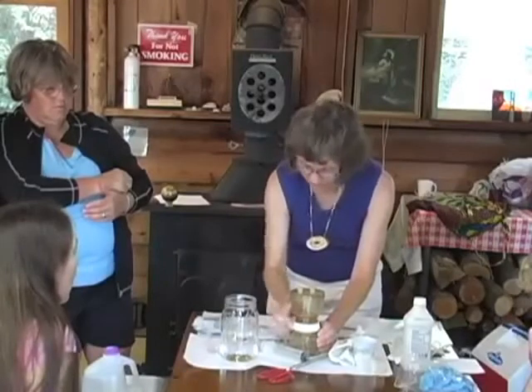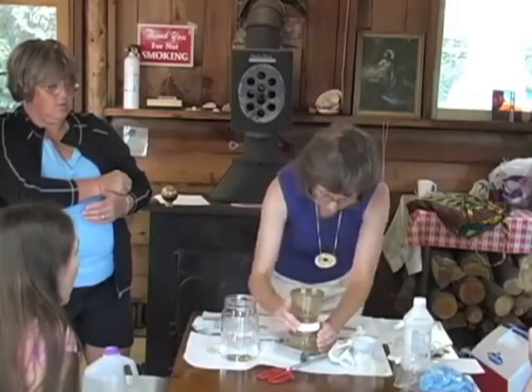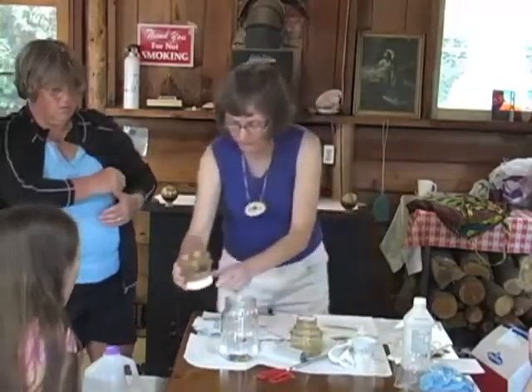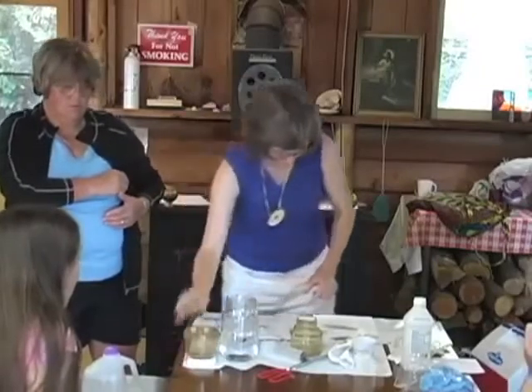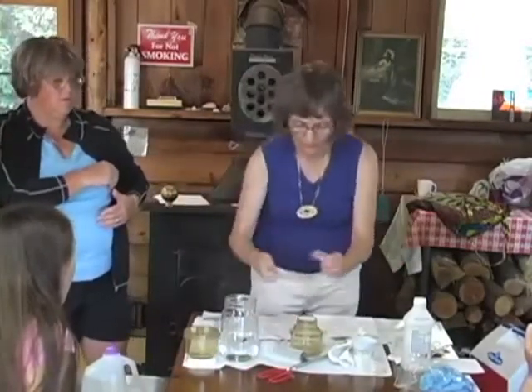Be careful about the top, because this is totally different than any one you have. If you have traction there, it can wrinkle your filter. Using the forceps, carefully move the filter paper into the dish, grid side up.